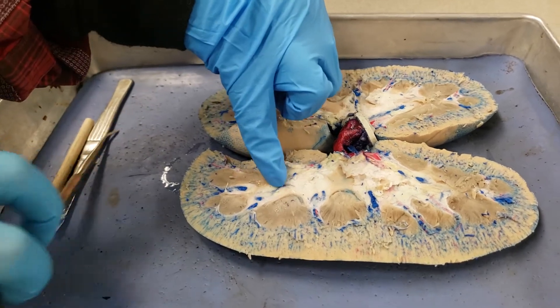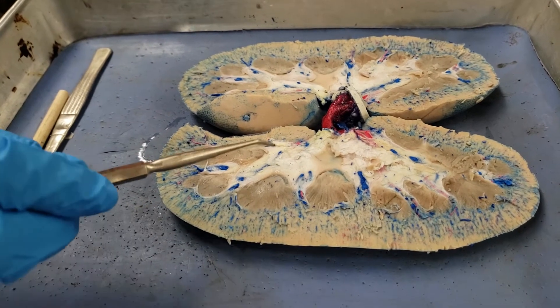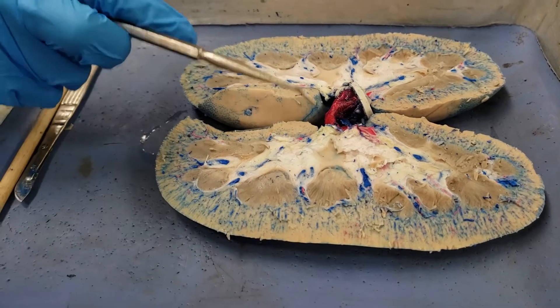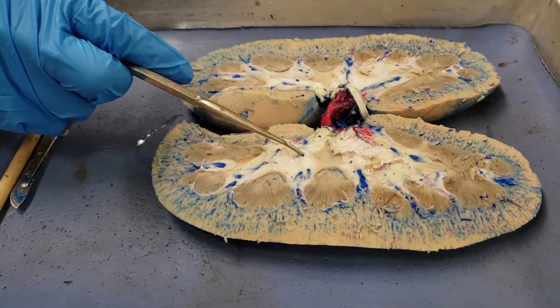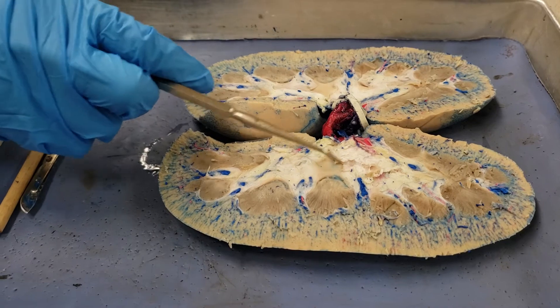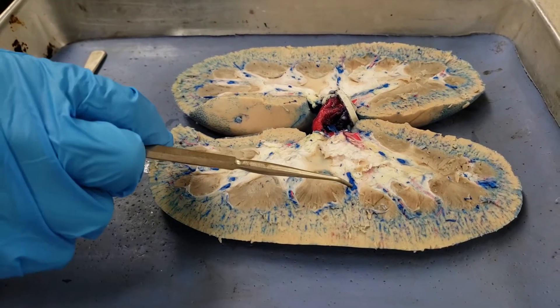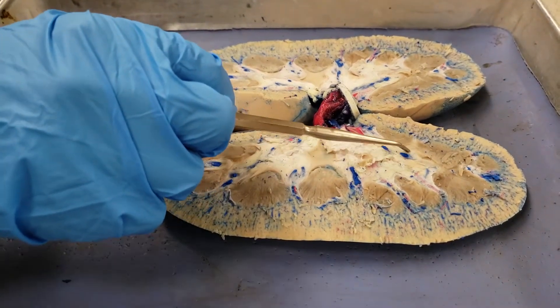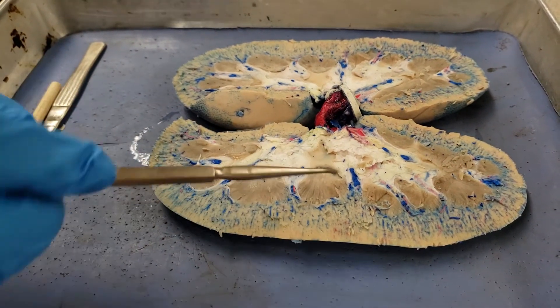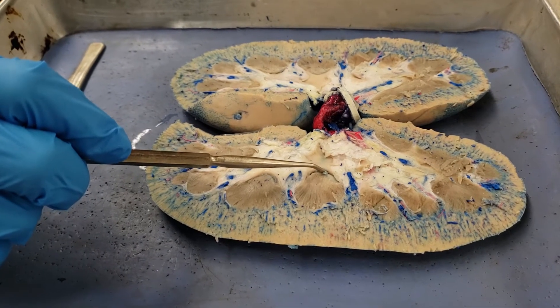These would be minor calyces. As soon as they come together, it becomes a major calyx. In here would be the pelvis, and then the ureter as soon as you leave. Anything sitting right close to the papillas — the papilla is the bump — those would be minor calyces.